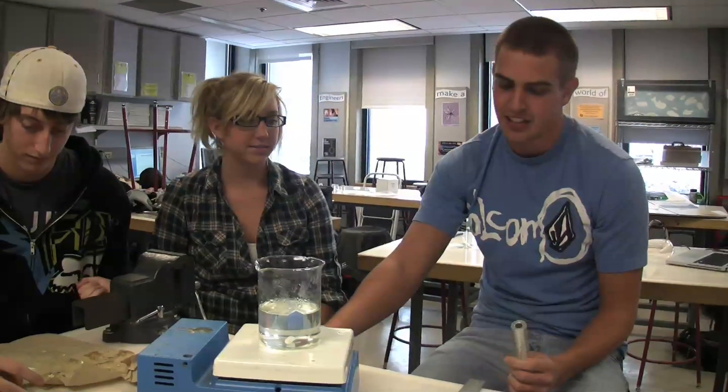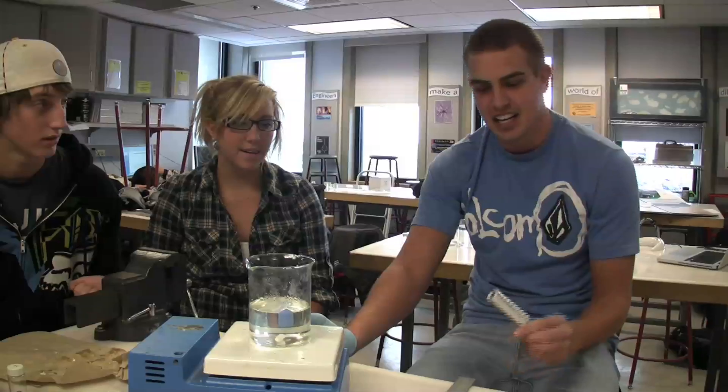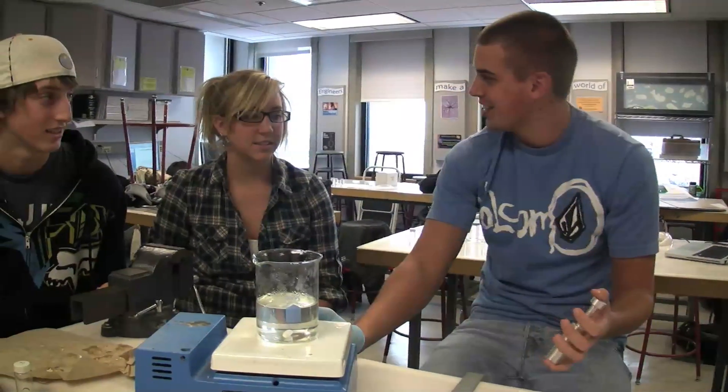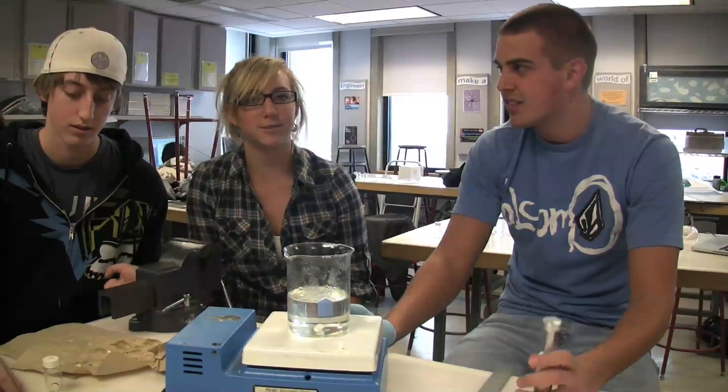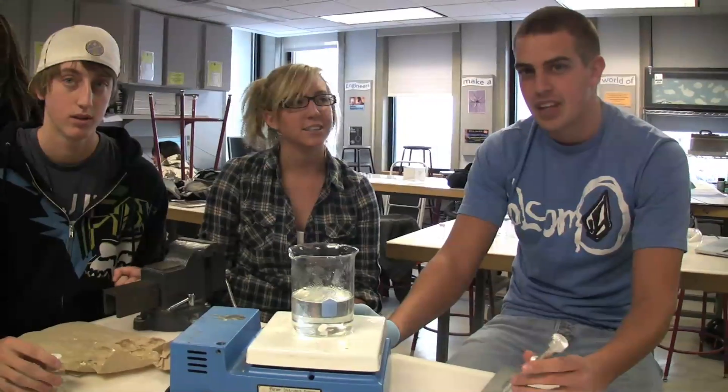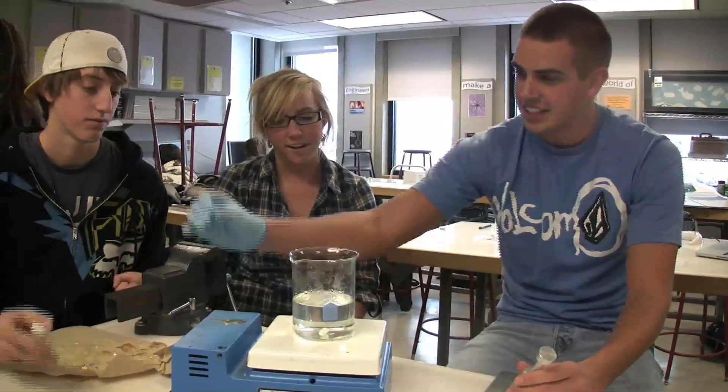What we decided to do was create a pill out of silica and alginate, and we just compressed it with this thing. We did random amounts of pressure — from 2800 psi down to 1000 psi — and we created pills like that.